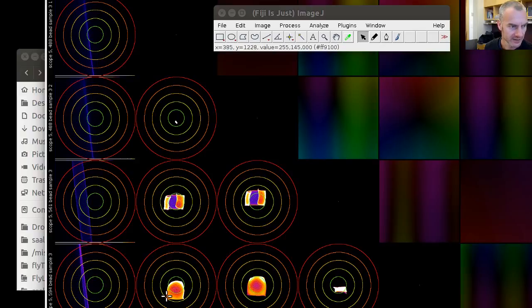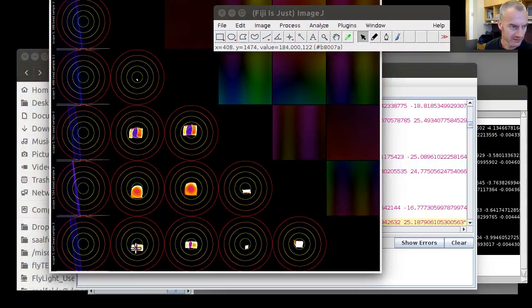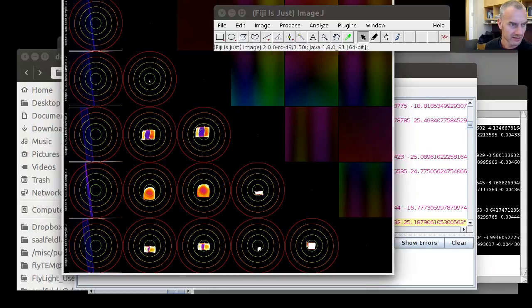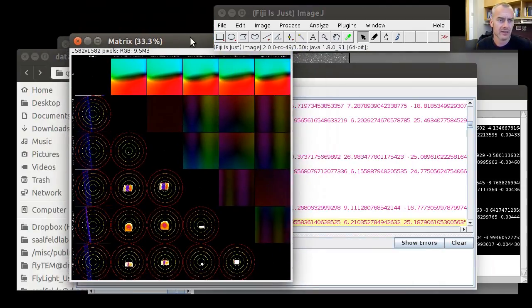It's good that we did that, because now we have these differences accounted for. Here's a little bit of a shift bias again. And down here, there's also a shift present. There's obviously not so much difference between these two wavelengths' lens models. Alright, so with these exports at hand, we can fix all our confocal stacks, and hopefully stitching and analysis of them will be more meaningful and visually pleasing. Thanks for your attention.